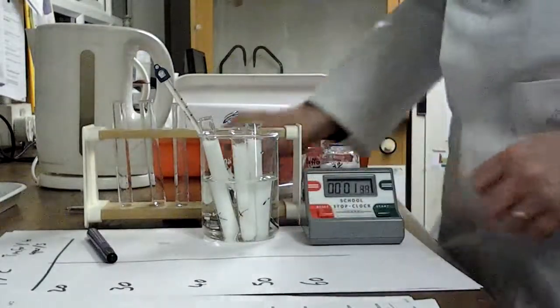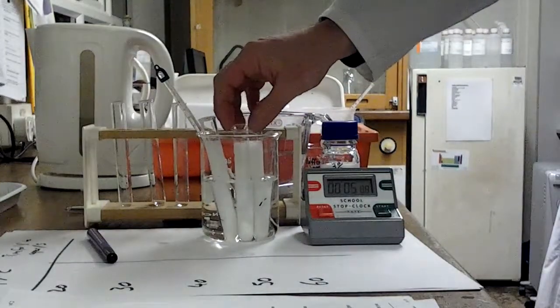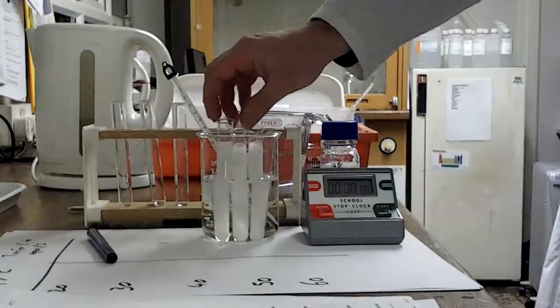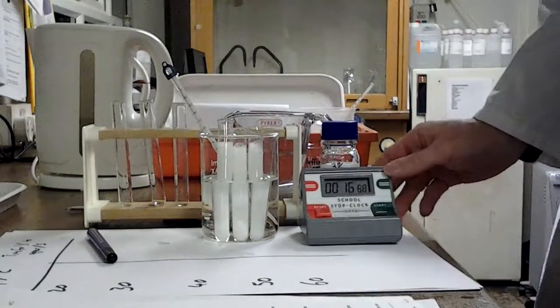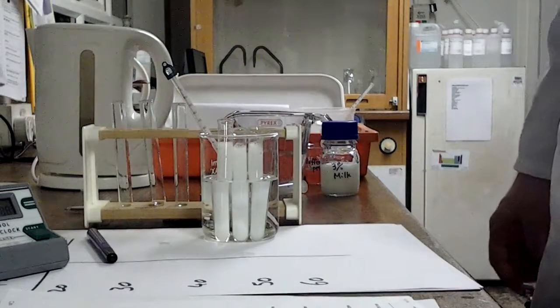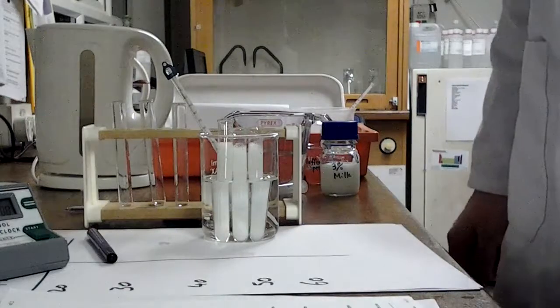Now I am looking for the moment at which I can see that X from the other side. A couple of my X's just start to come off ever so slightly, so I'll have to make sure I look very carefully on those. But I'm looking for an X becoming visible through this liquid as the enzyme breaks it down. This is my lowest temperature, so think about what you know about enzyme kinetics. This is the one that's going to take the longest.